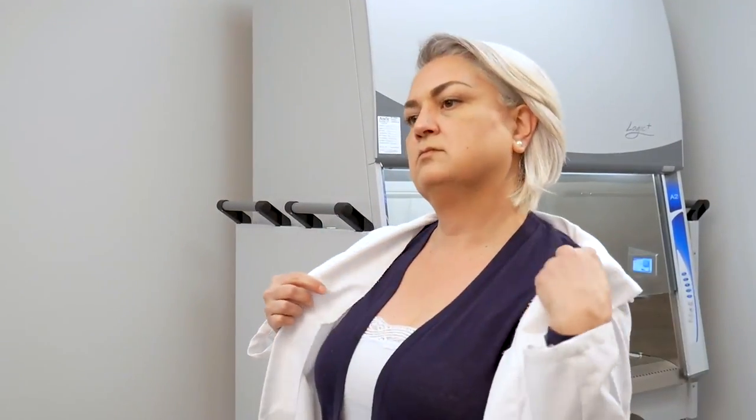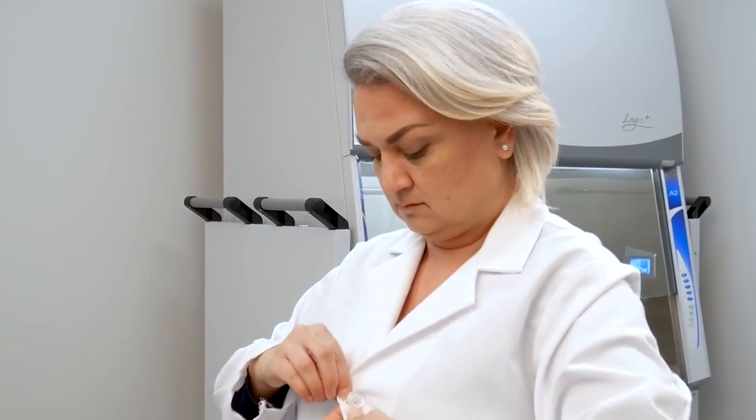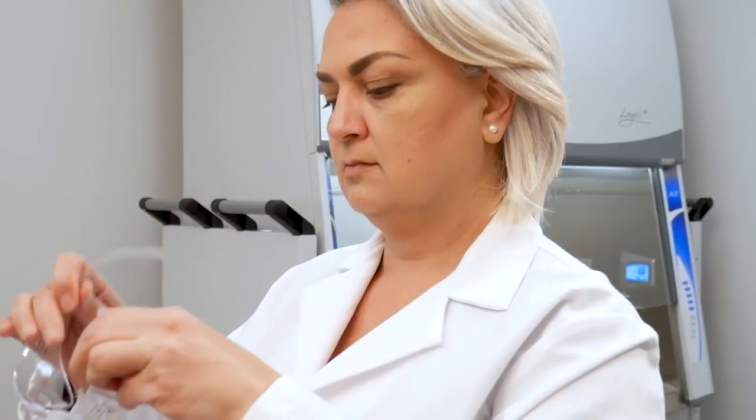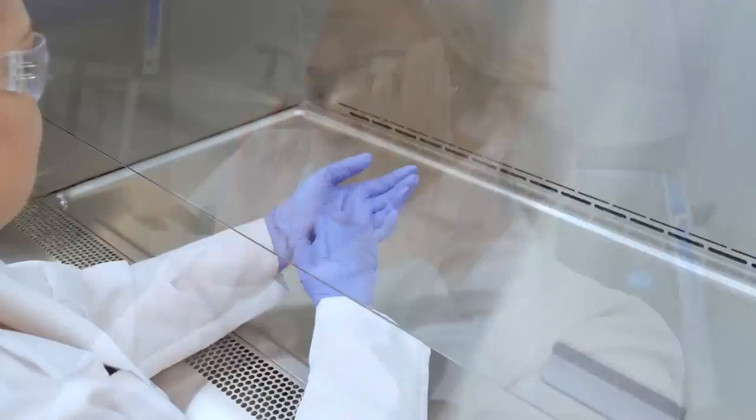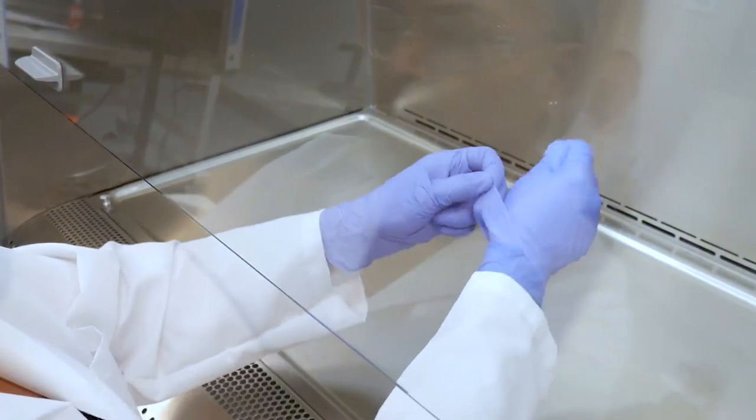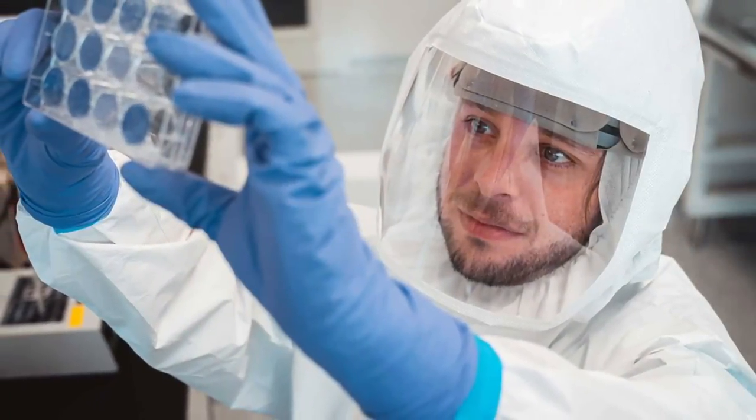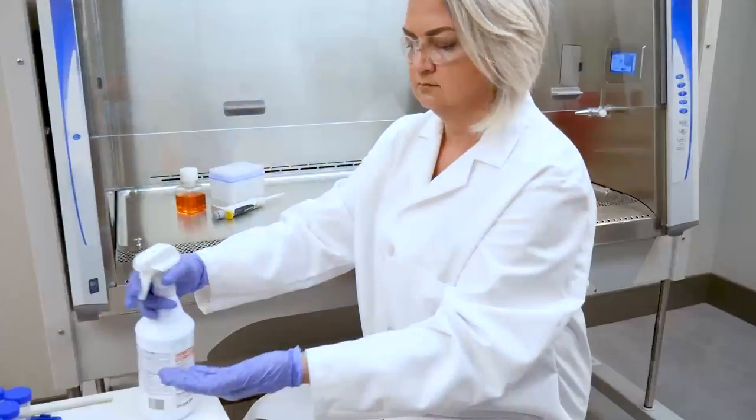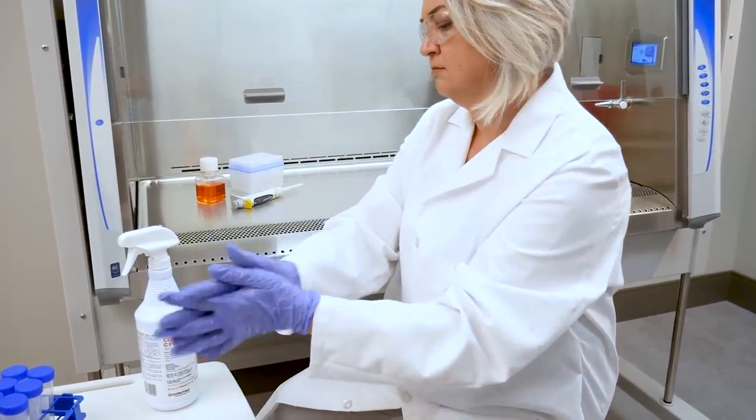PPE protects you from hazardous materials within the cabinet, but also reduces contamination of your samples from your body. A minimum of a lab coat, safety glasses, and nitrile gloves are typically required. For additional safety, the practice of double-gloving can help reduce exposure during and after work. Certain types of work may require additional PPE. Consult with your biosafety officer if you are unsure about any requirements.